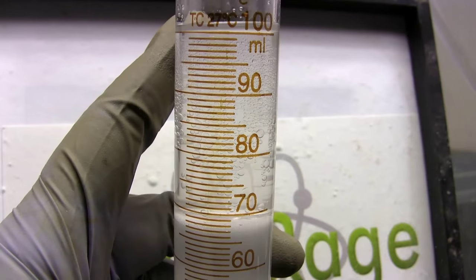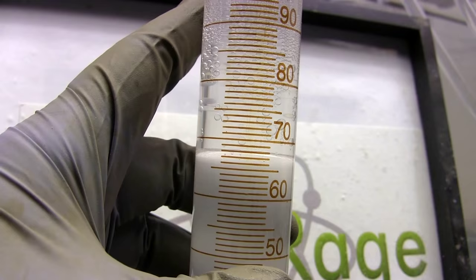Looks like we have something, about 32mL worth out of 50mL. Now while the volume is misleading because some of the methanol and ketones are also dissolved in it, this still seems worthwhile to try and distill.